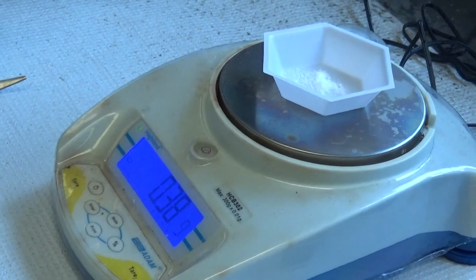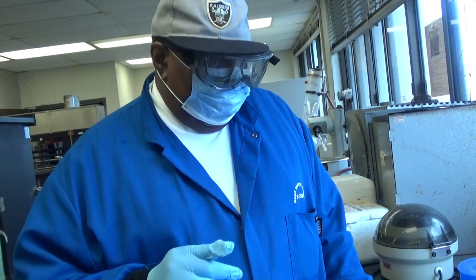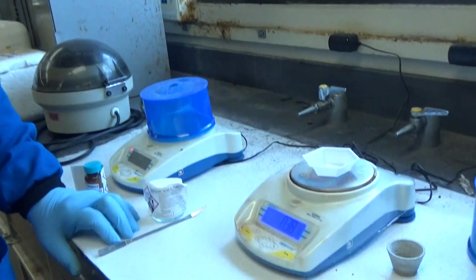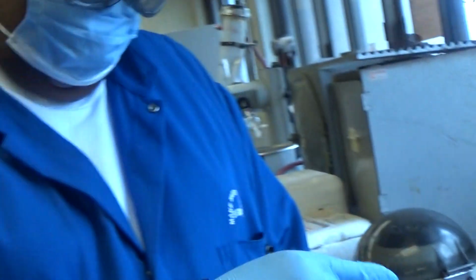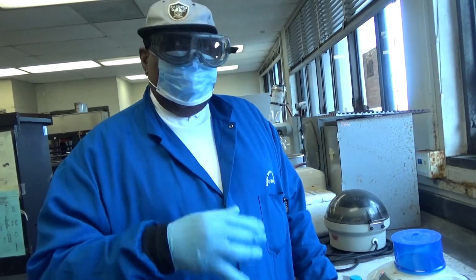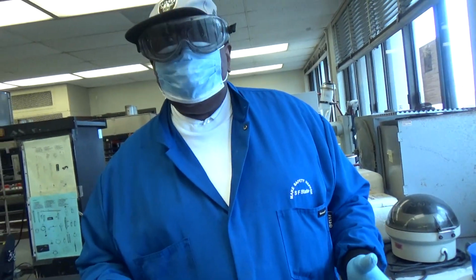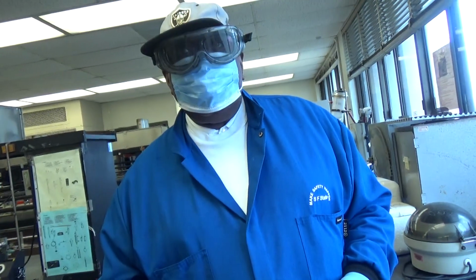So what you need to know here is that the amount of pure benzoic acid you are going to get after recrystallization has to be less than the amount of crude product, because this one is a crude product. Crude product means that you have your product and some impurities. So you're hoping to get maybe 200 milligrams or 100 milligrams or something less, because if you have more, that would be a problem.